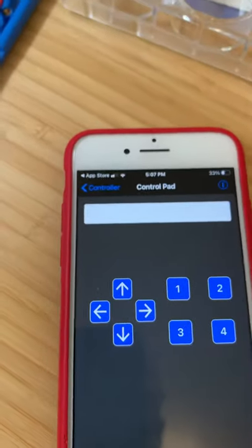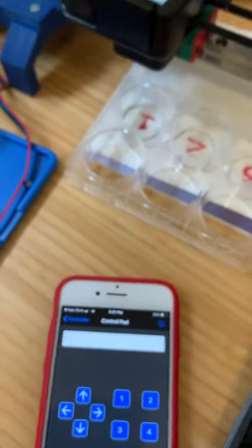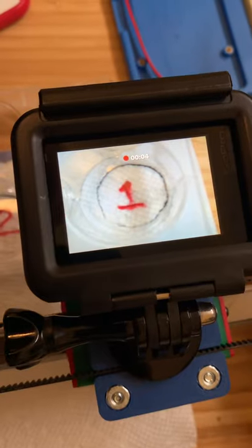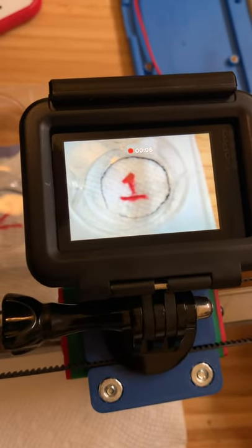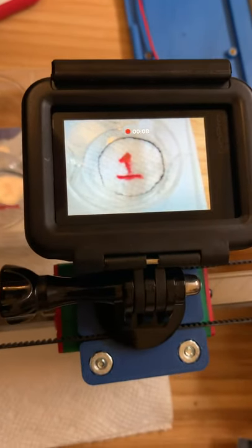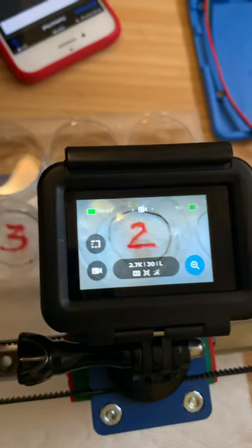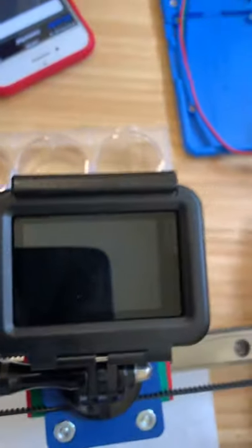Okay. With the forward button, there's a delay here as it connects to the Wi-Fi. And then, what you can see over here, is it's now recording. And I set this up for only 10 seconds per cell because I wanted this demo to move fairly quickly. As soon as it finishes the time I've given it, it advances to the next cell.